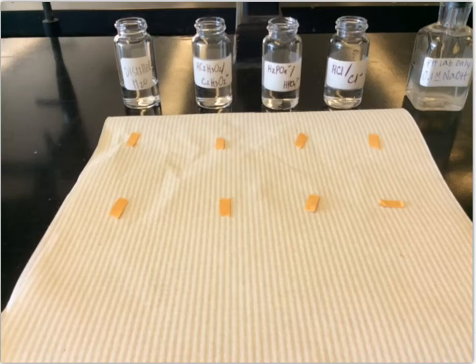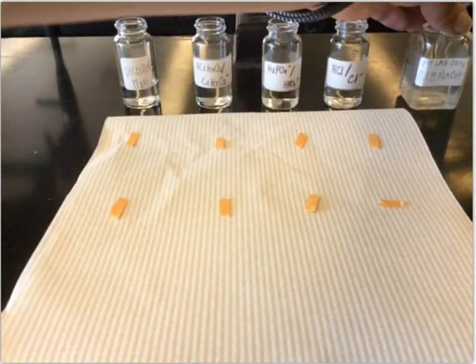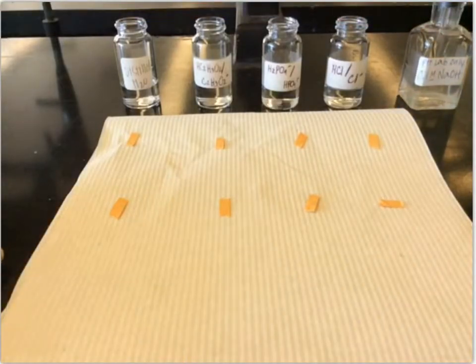For this part of the lab, we're going to study how different solutions are affected by adding a strong base. So the strong base that we're using is NaOH. And what we're going to do is measure the starting pH of our solutions, and then add 10 drops of that NaOH to each of those, and we'll measure what the ending pH is to see what effect adding that strong base has.